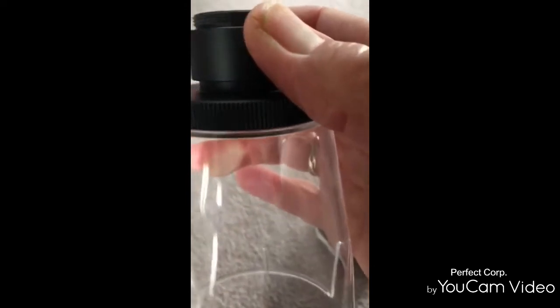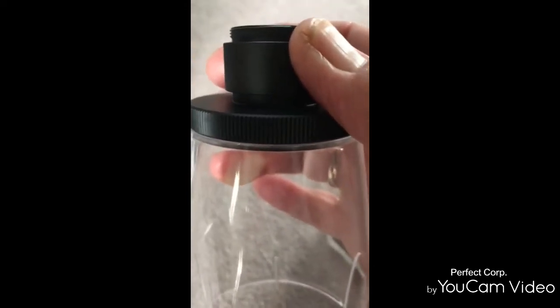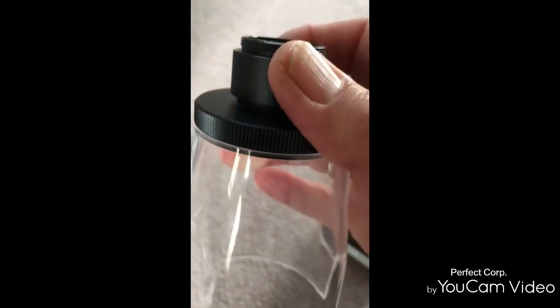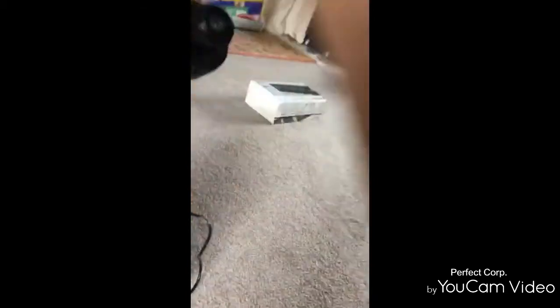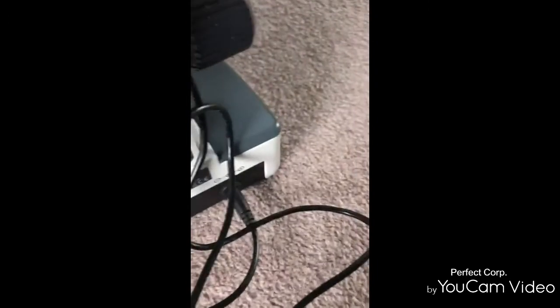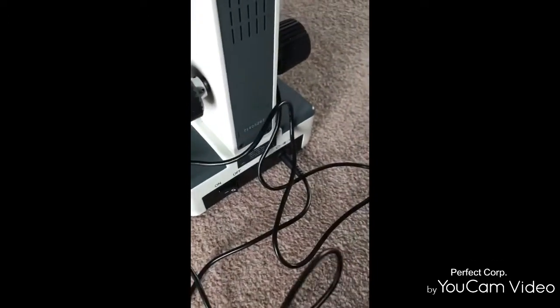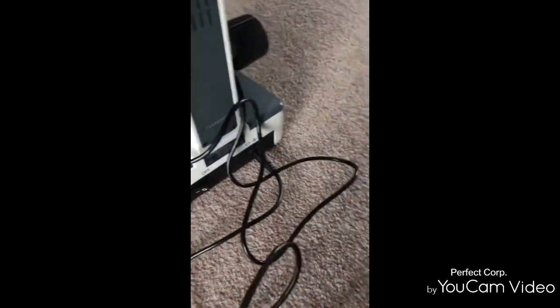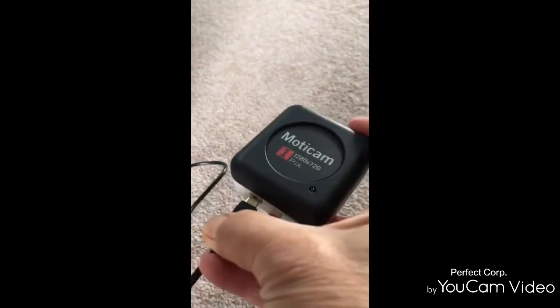So it's this bit here. I am just screwing it up tight and then connecting the USB into the camera.